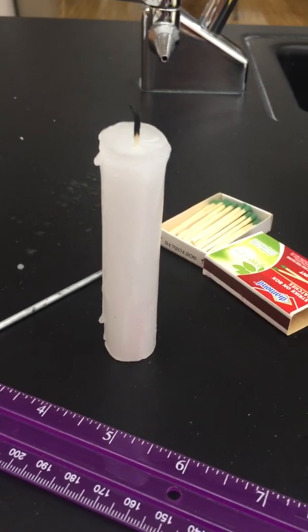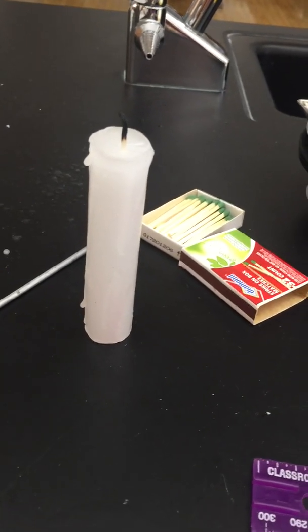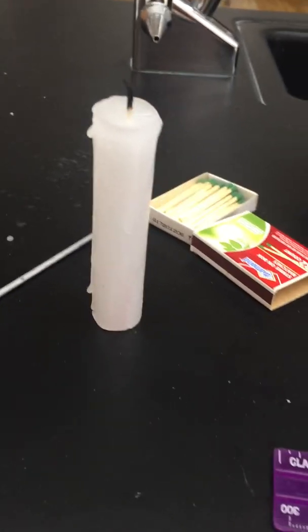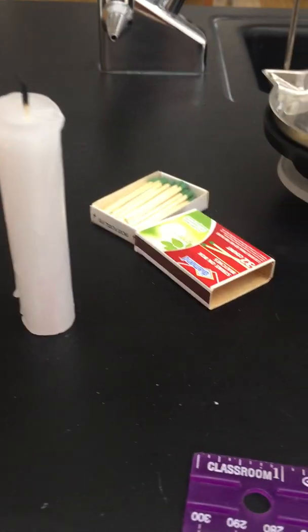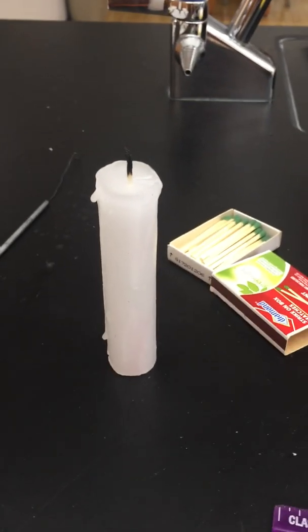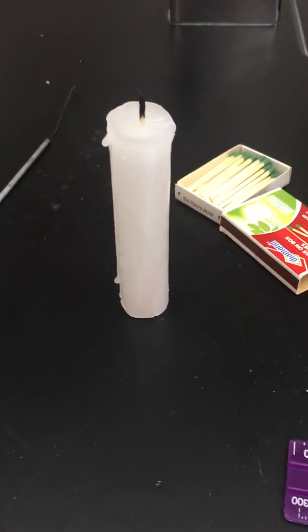There are your observations. Unfortunately, if you are not here, you can't feel it, you can't smell it. The color should have been okay, but everything else, the measurement part should be good. Okay? I didn't take the diameter afterwards, but that should be fairly obvious. All right. Good luck with that.